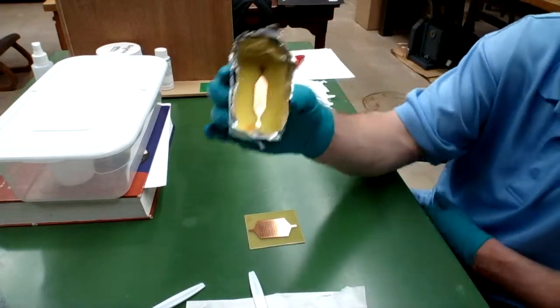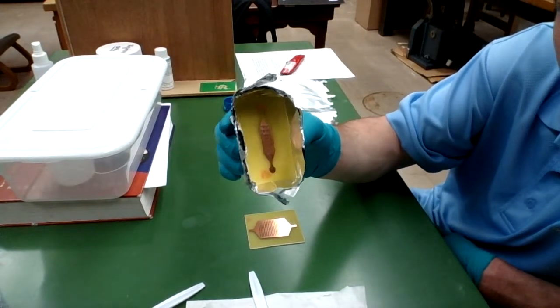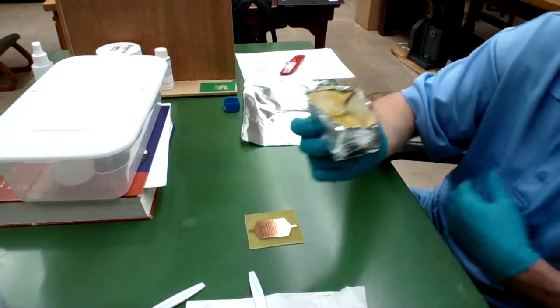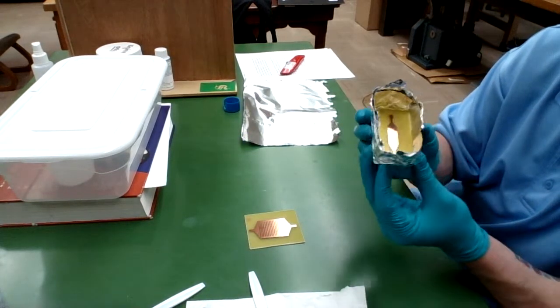Alright, so there we go, we have a little vessel for our design. So I'm going to pour my PDMS onto this guy when it's all degassed and then throw it in the oven and it'll cure it.